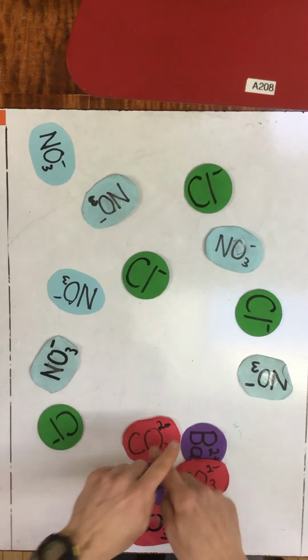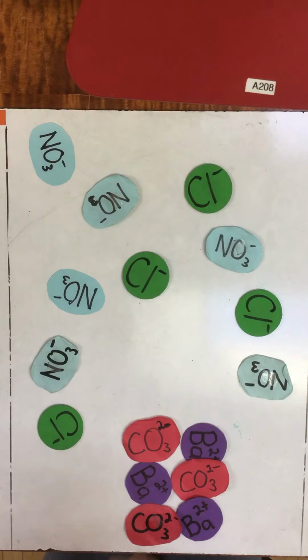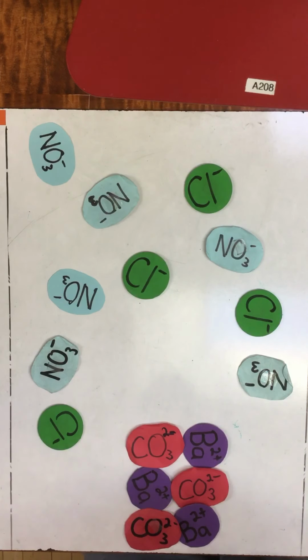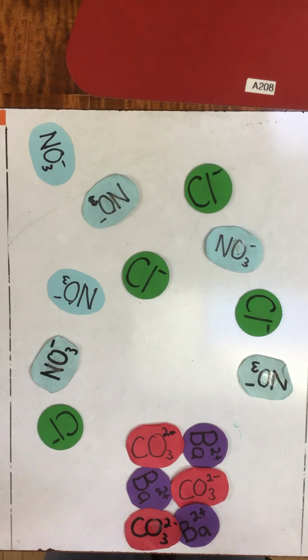All right. So now again, we have a precipitate at the bottom of the solution, which we can filter out. And the chlorides will still be dissolved in the solution, but the solution will just have chloride ions, and we'll take out all of the carbonate ions. In order to do that, you have to add enough barium to get the carbonate out, but that's easily done. So solid barium carbonate separated from aqueous chloride now. So that's one that works.